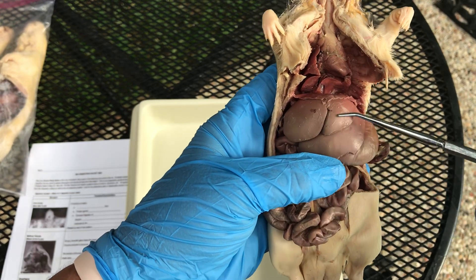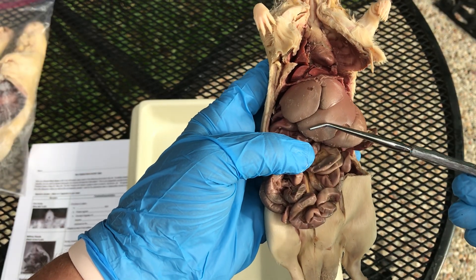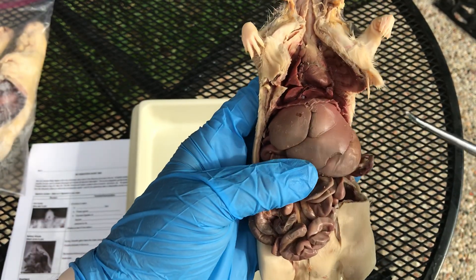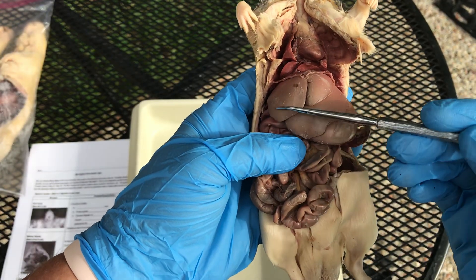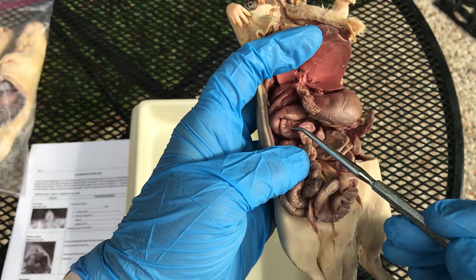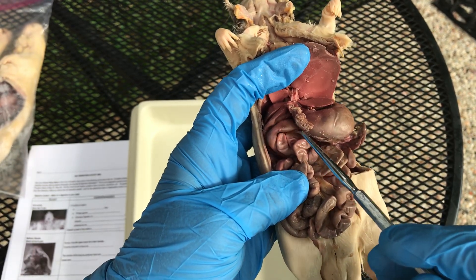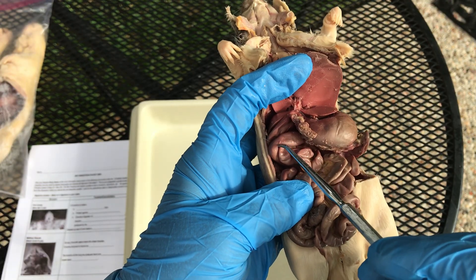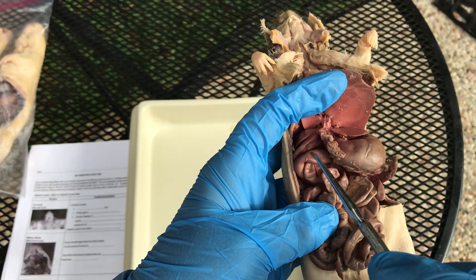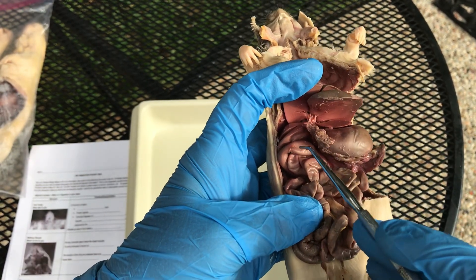The next accessory organ is the liver — this giant structure here with different lobes. The liver's job is to secrete bile. In humans we store bile in the gallbladder, located underneath the liver, but rats do not have gallbladders because they don't have a high-fat diet. Rats directly release bile through ducts into the duodenum. What bile does is mechanically break down large fat globules into smaller fat droplets — like taking a big glob of fat and breaking it with a hammer. Bile is an emulsifier, not an enzyme.